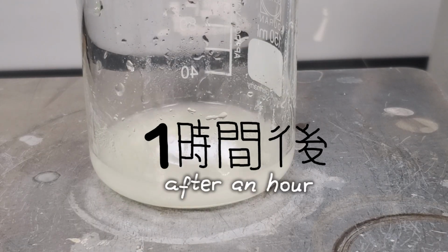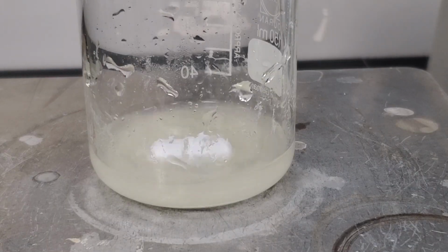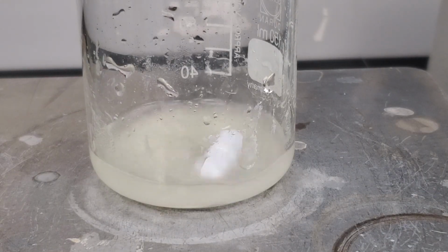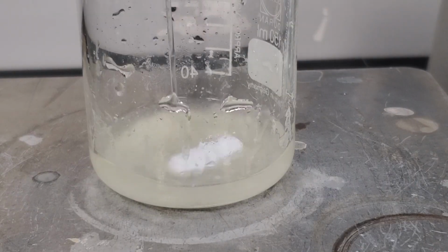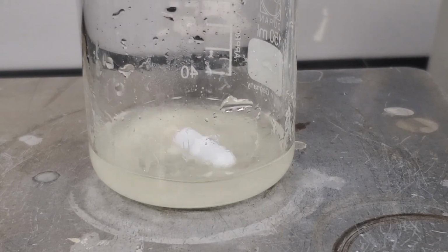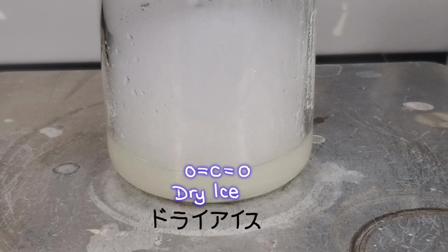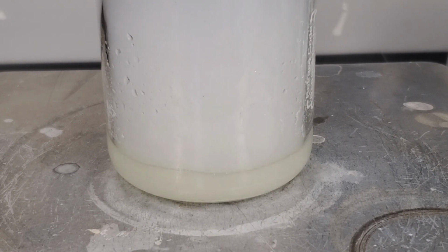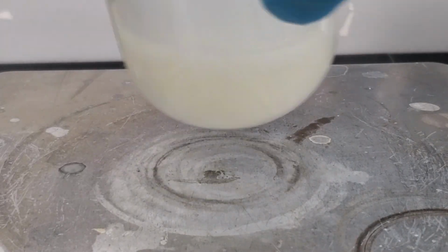After about an hour, most of the gas evolution had stopped. To liberate the product from the borate salts, I added 8 ml of 18% hydrochloric acid. The acid protonates the intermediate and decomposes borate complexes, freeing the alcohol. I dropped in a chunk of dry ice to cool the solution during acidification, but that's totally optional. Cold water or an ice bath would work fine.